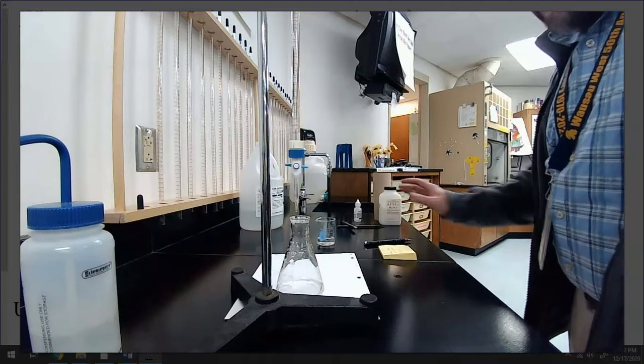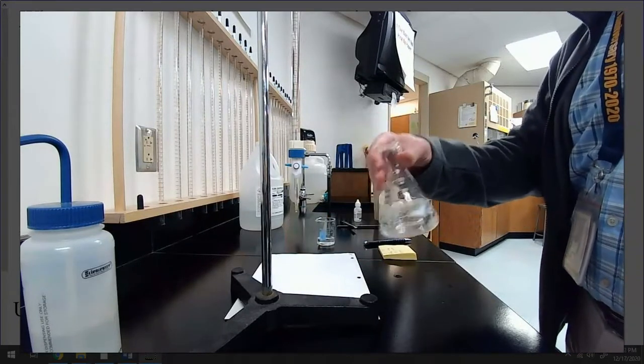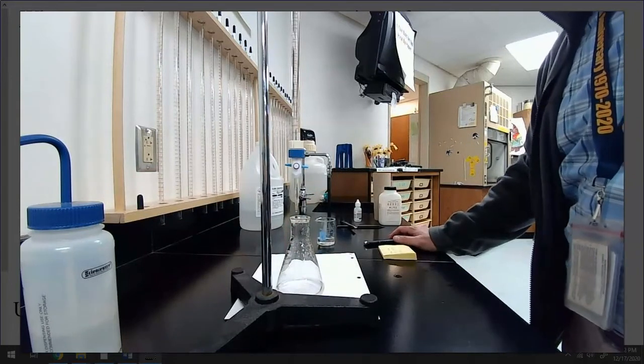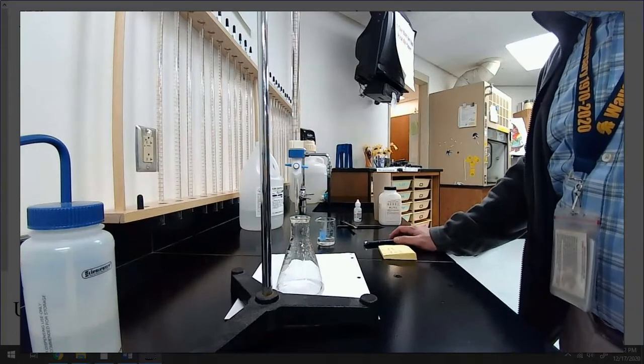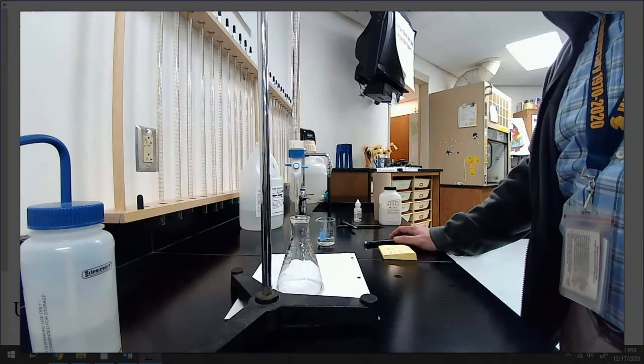And what I have is the mass. I already put this in water, so my unknown solid acid I've already massed out. The mass of the second trial was the exact same as the first trial. I was nice to you. I could have given you different ones, but I figured whatever, I'll try to get it perfect. So I have, again, 0.506 grams of my unknown solid acid A.